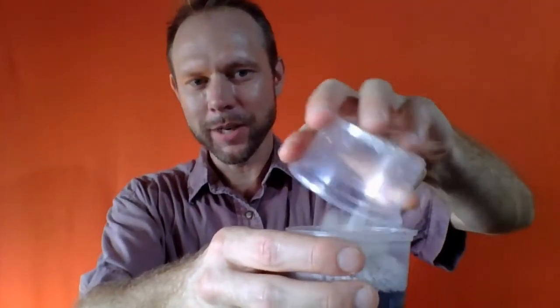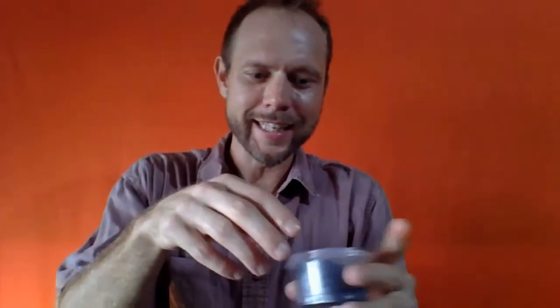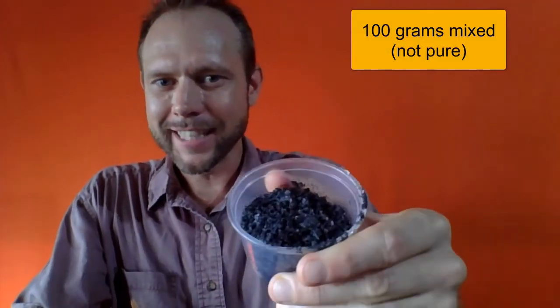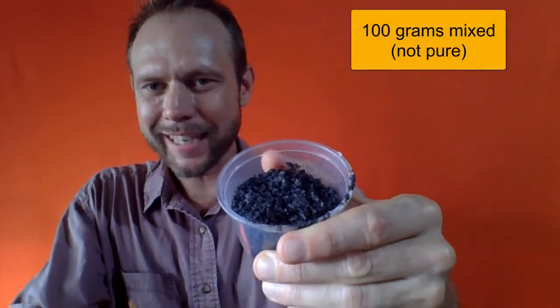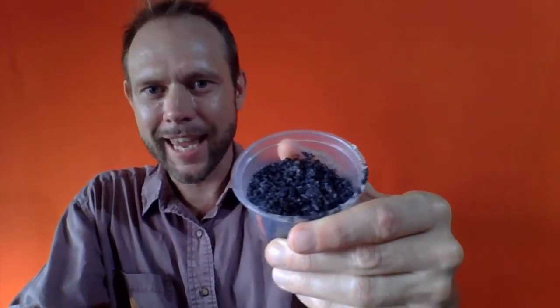And now, how easy would it be to mix these together? I'm just going to pour the salt on top of the sand, and it's not very well mixed at the moment, but I'm just going to put this lid on, and I'm going to shake it around for a little bit less than a minute or so until they are combined, and I've now got 100 grams total. The problem is it's not pure anymore. It's a mixture of 60% sand, 40% salt.